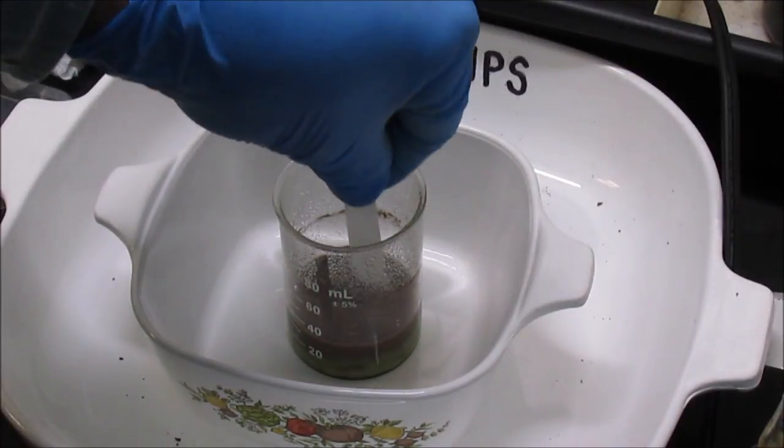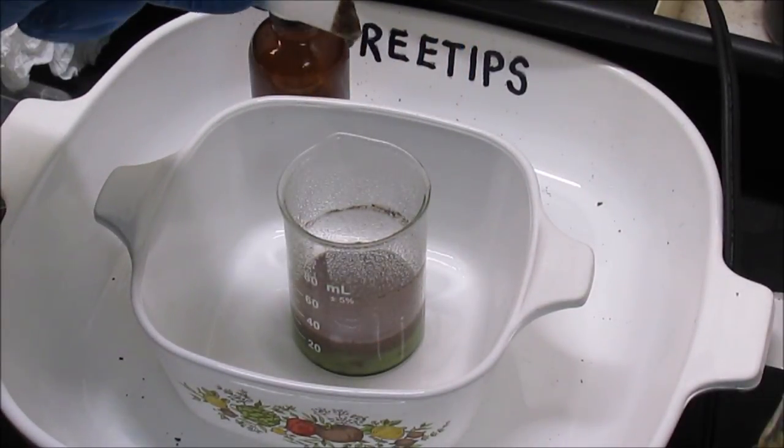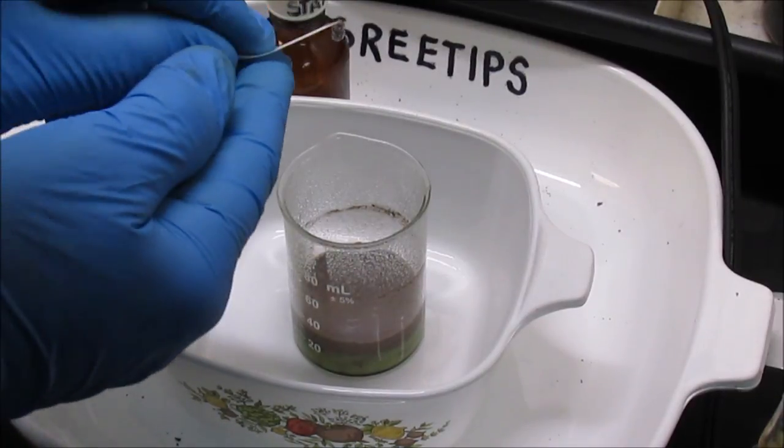In this shot I dip a strip of filter paper into the piranha solution, and as you can see, it just dissolves the paper almost instantly.